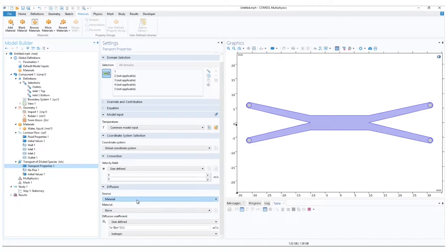Here we have our source as material, and as the material, we have to choose water. Water self-diffusion coefficient is heavily temperature dependent and can be looked up from scientific articles or even online. At 20 degrees Celsius, the coefficient is roughly 2.02 times 10 to the power of minus 9 square meters per second. Now we can proceed with inflows and outflows.